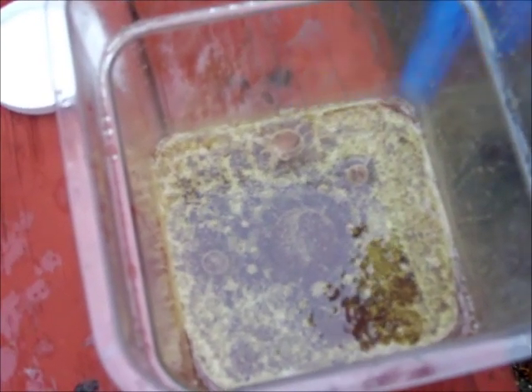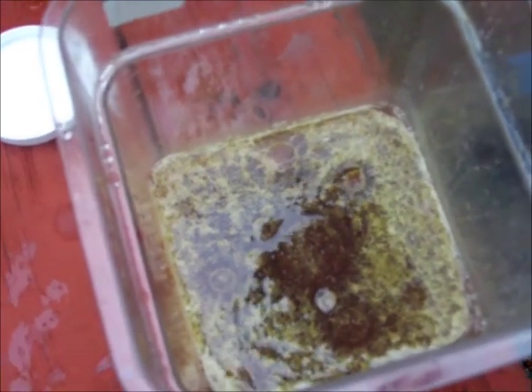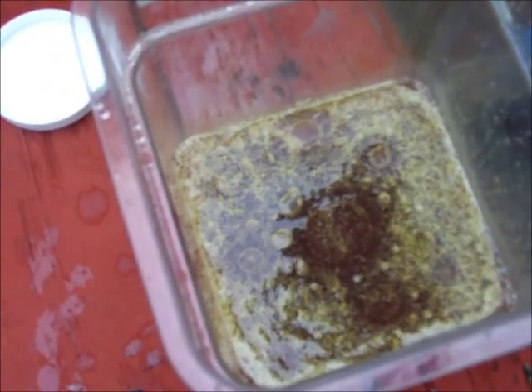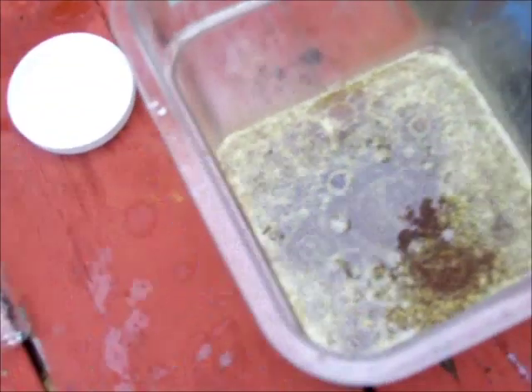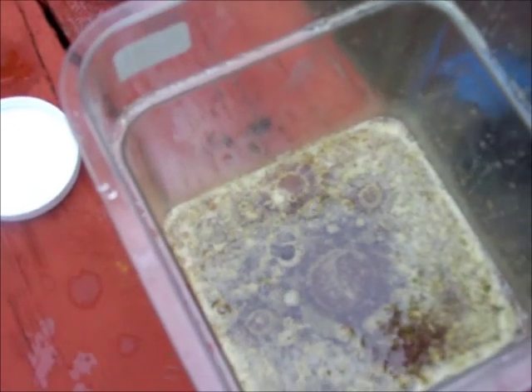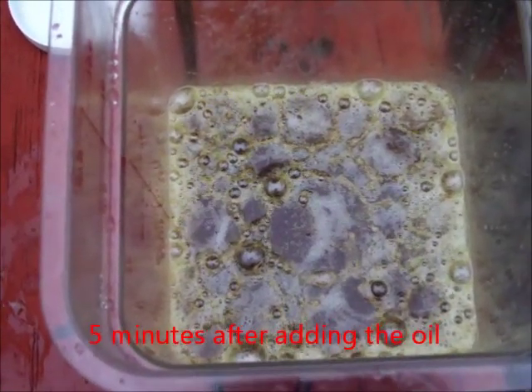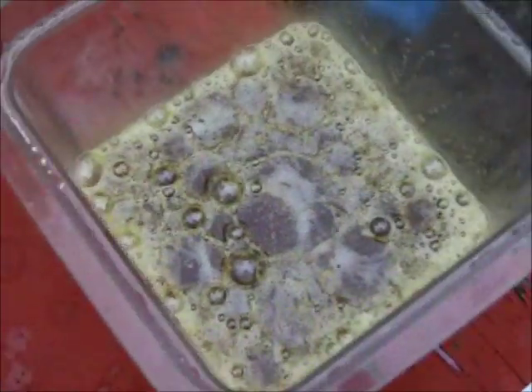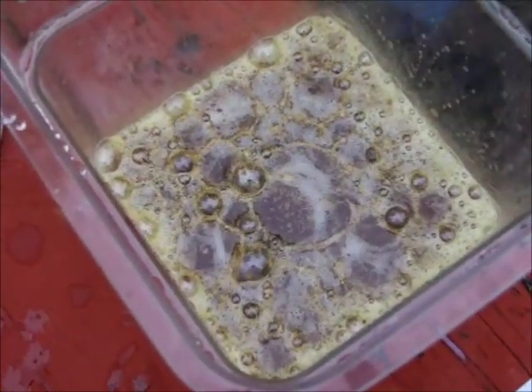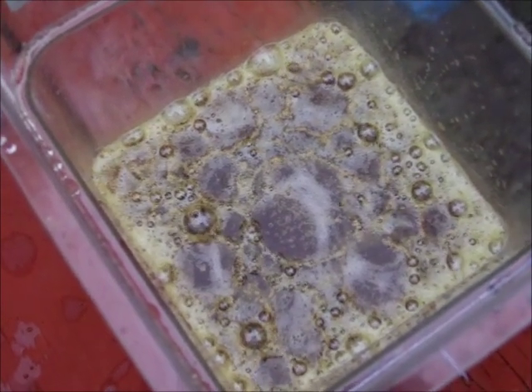You can see the slight bubbling and watch it react, which is why it's spreading out bubbling and breaking up slightly in a little circle. It's been a few minutes and it's starting to bubble more vigorously.